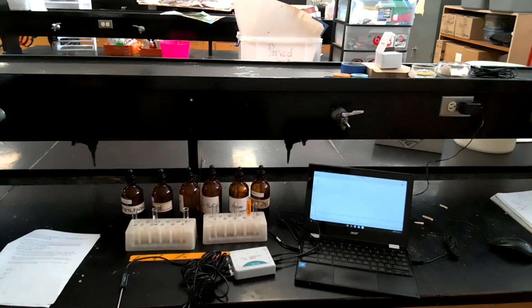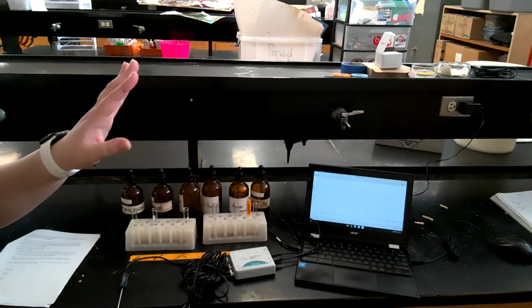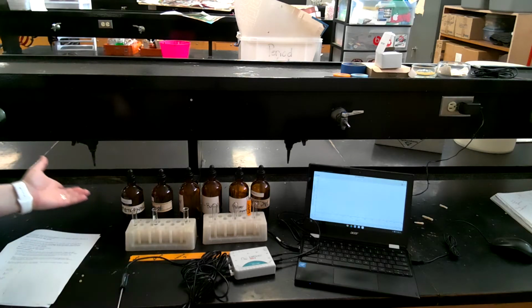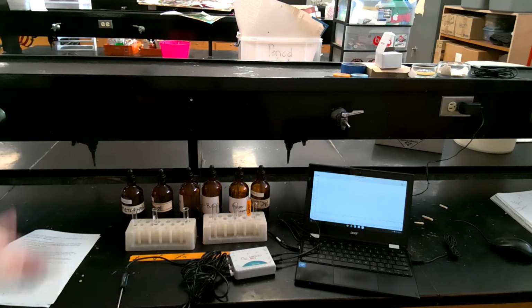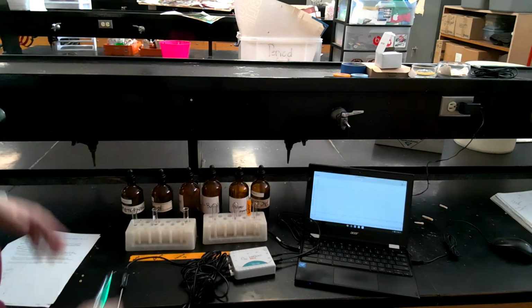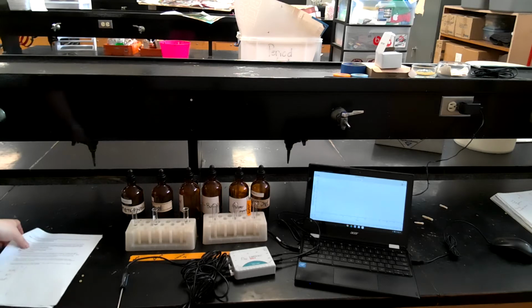If you want to compare this to water, I know that in my chemistry class last year I gave some analogies, like if you left a drop of rubbing alcohol on the counter and then water, which one would evaporate faster. If you came back an hour later, you would see that the rubbing alcohol did. So now what if we gave all alcohols to test which of these would evaporate at the fastest rate without adding any kind of heat to it?